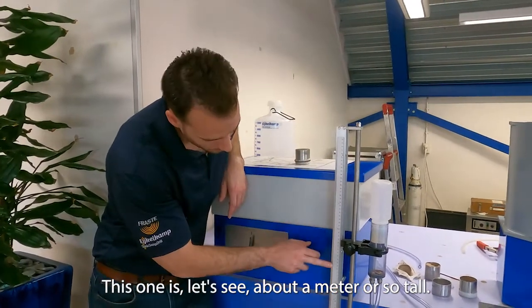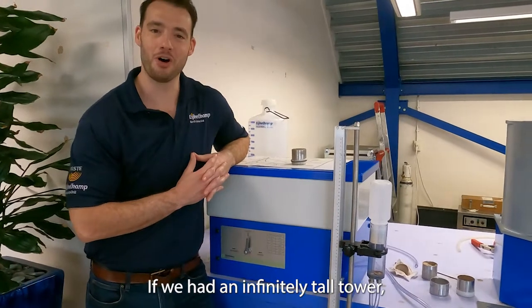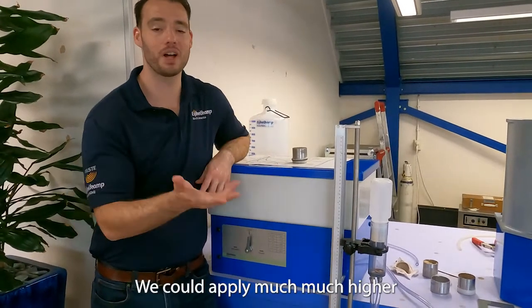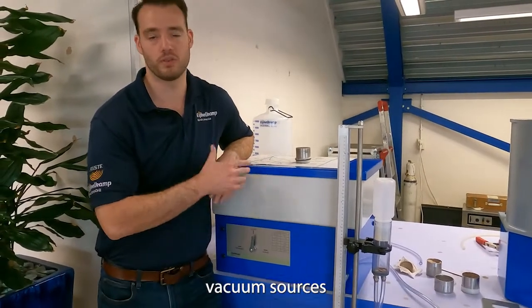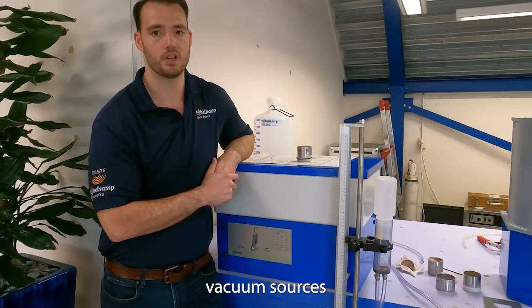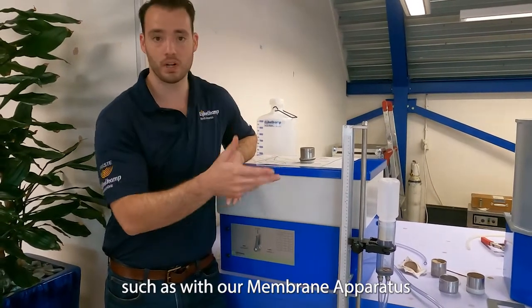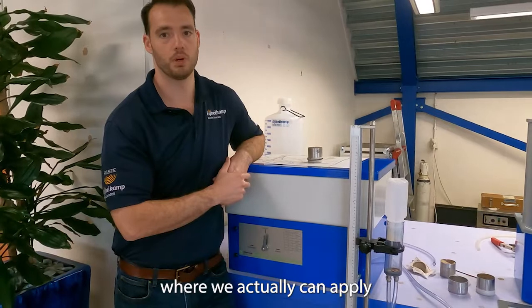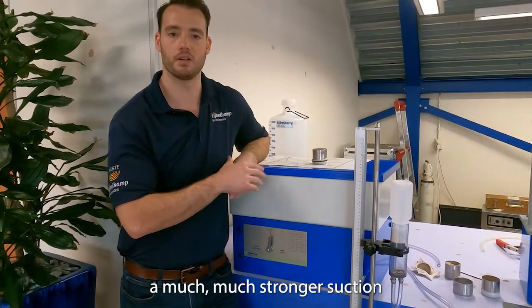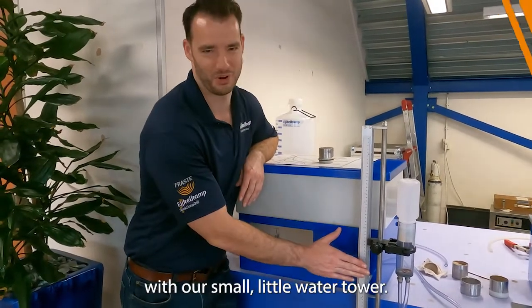This one is about a meter or so tall. If we had an infinitely tall tower, we could apply much, much higher suction. But that's where we need to get into external vacuum sources, such as with our membrane apparatus or with our sand and kaolin set, where we actually can apply a much, much stronger suction than we can do here with our small little water tower.